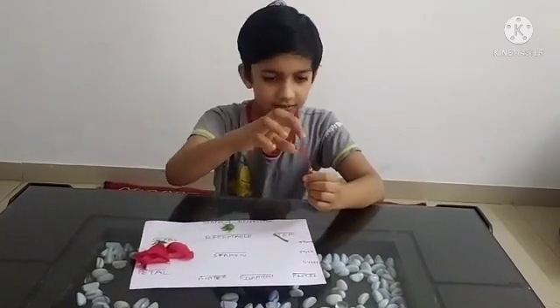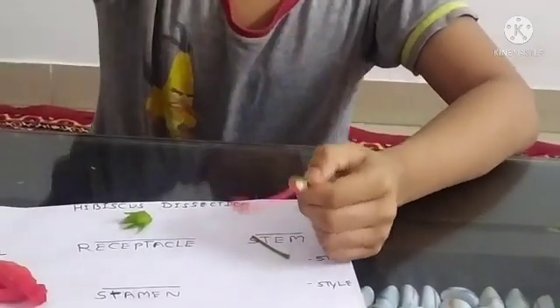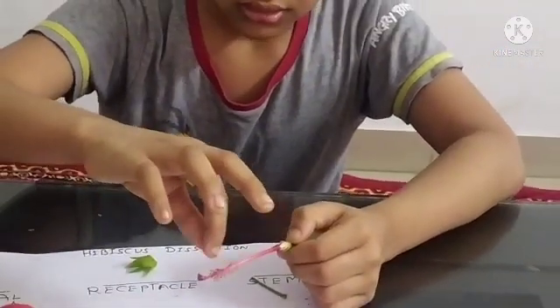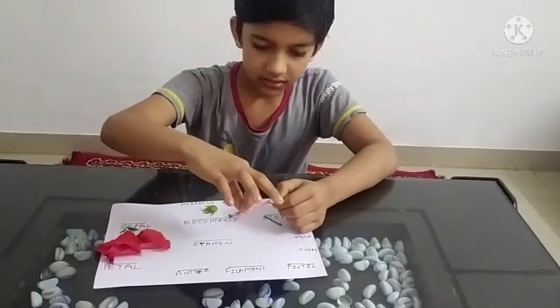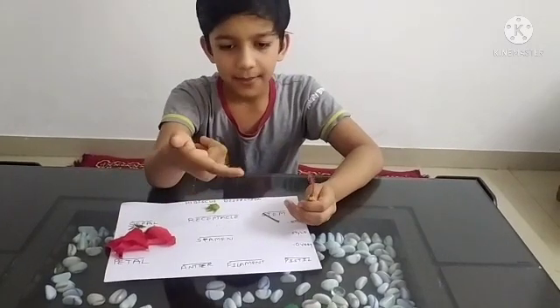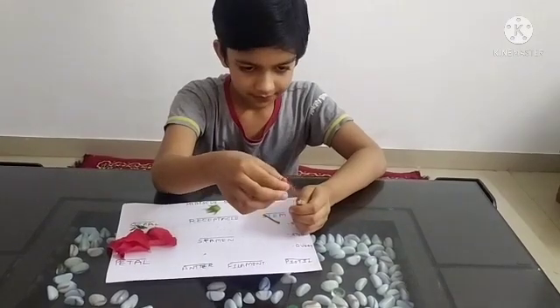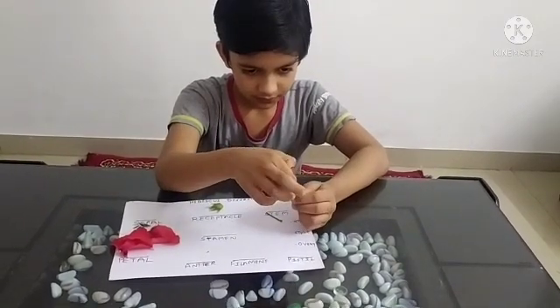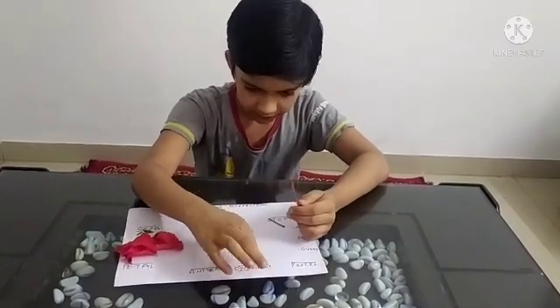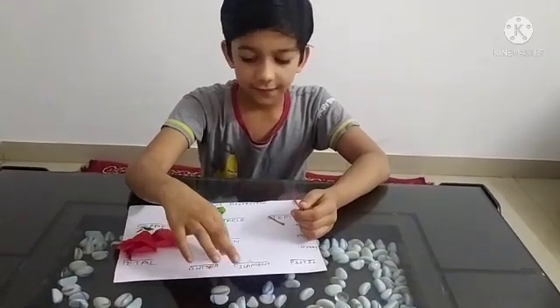Now start to take out the stamens — you have to remove like this. The tiny dots over the filament are the anthers, and the stalk of the anther is called the filament.